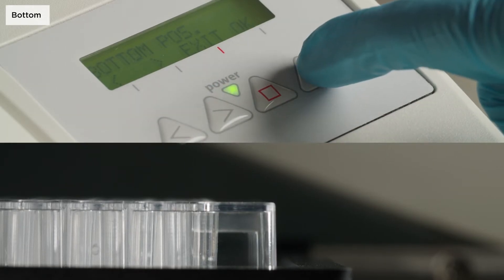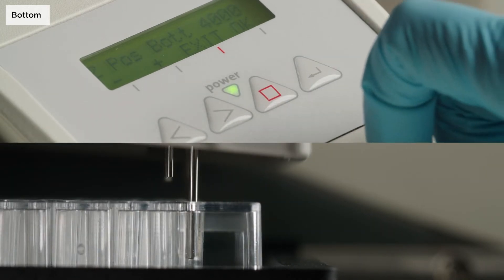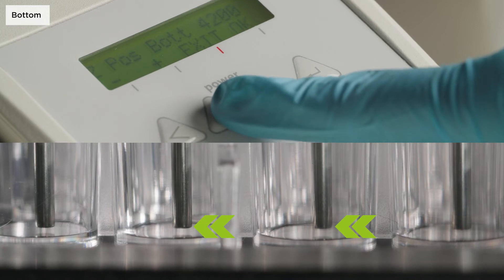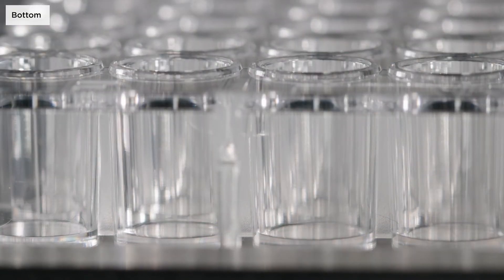For the bottom position, the needles should be as close as possible to the well bottom. Make sure the needles do not touch the bottom. The lower the bottom Z position, the lower the residual volume.